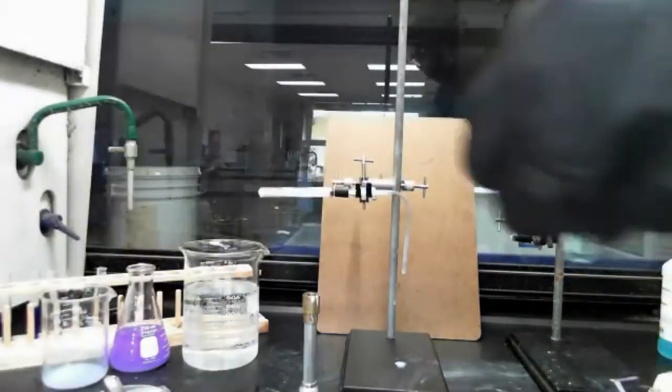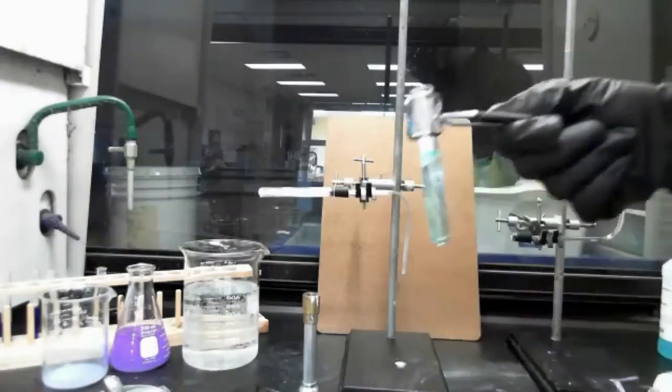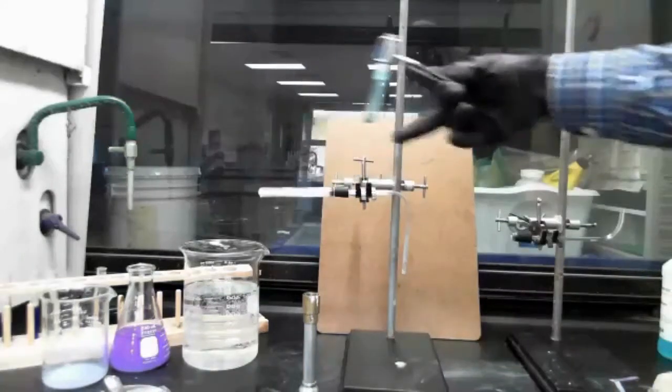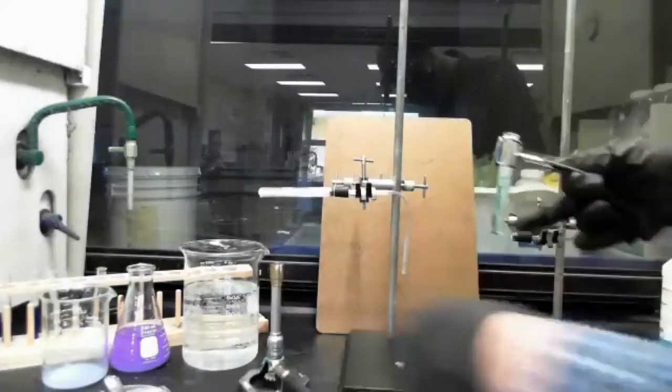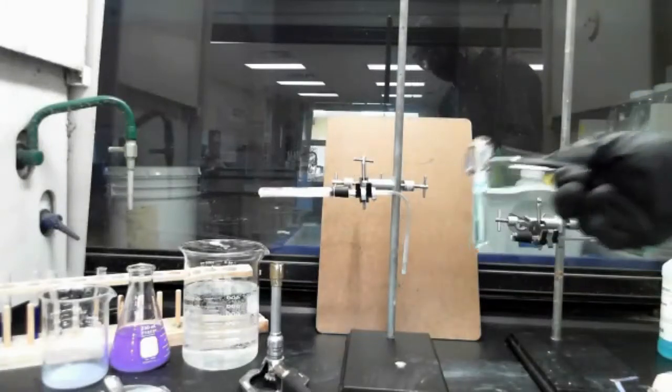And I'm going to hold it with this test tube holder so that you guys can see what I'm doing. I'm going to hold this in here so that the gas I generate here using the Bunsen burner will bubble through here and out here and into this solution.